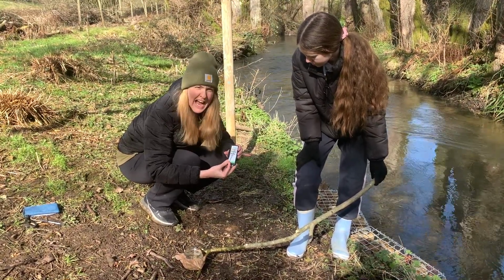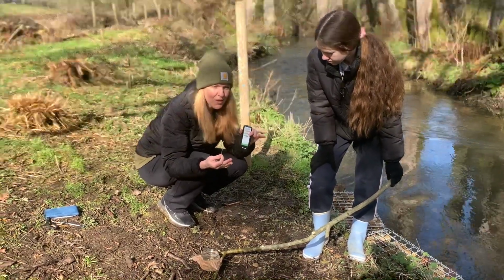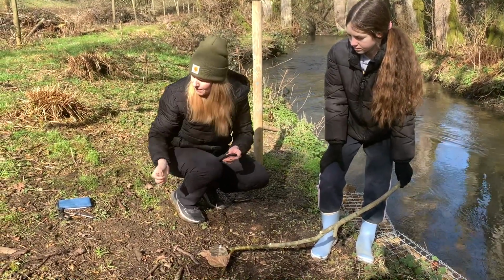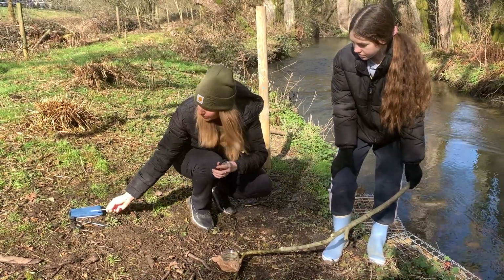You want to record the halfway point. There's no way for you to sort of say, well, it's 33%. Just take the halfway point. That'll make your life easier. After you're done with your strip, put it aside. Do not put it back in your container or you'll ruin the other test strips.